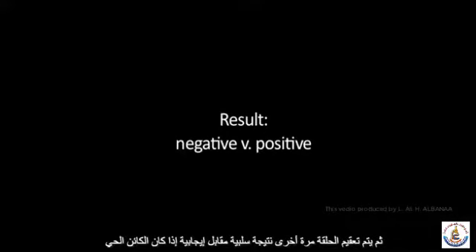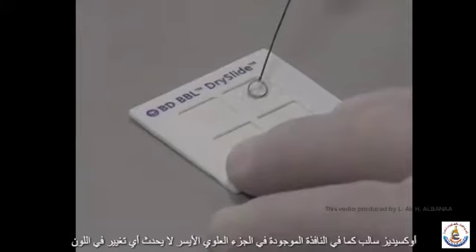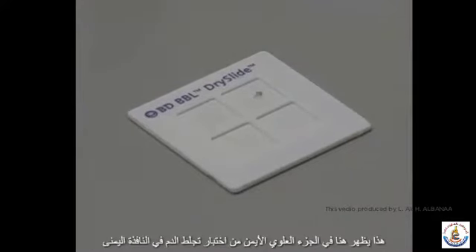Result: negative versus positive. If the organism is oxidase negative, as in the window on the top left, no colour change occurs. However, if an oxidase positive organism is tested, a blue colour appears within 30 seconds. This is seen here in the top right-hand window.